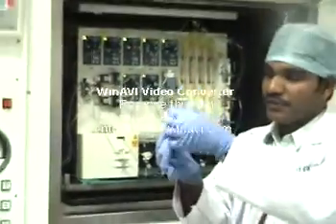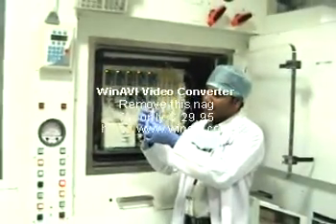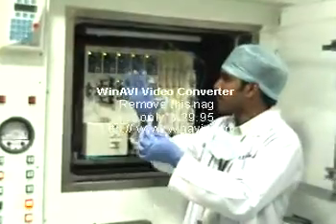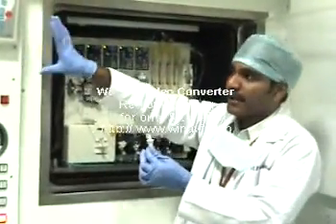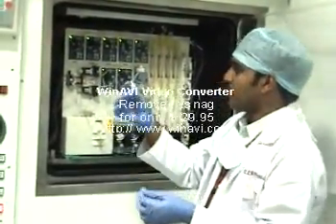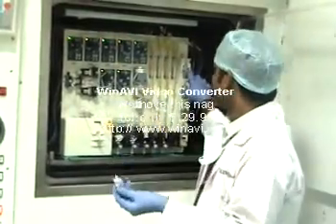Once the F-18 fluoride is delivered and transferred from the vial to the Explorer module, it gets collected in the QMA. We can see on the monitor how much activity is collected in the QMA, because it is interfaced with the computer and everything is software controlled. There will be 4 QMAs because we can produce 4 batches of FDG using this module.